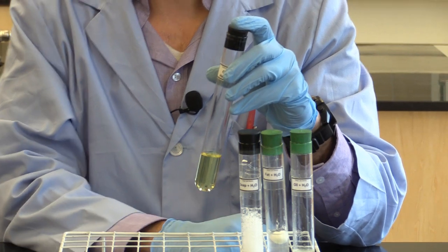Second, let us test our theory of like dissolves like by trying to dissolve each of the items tested previously in hexane. Hexane is quite nonpolar.